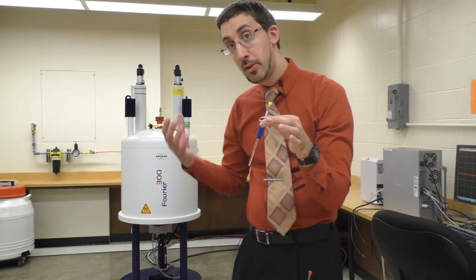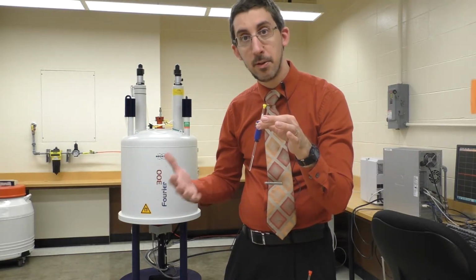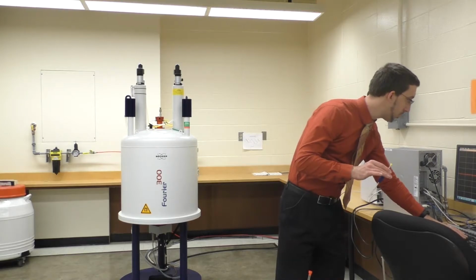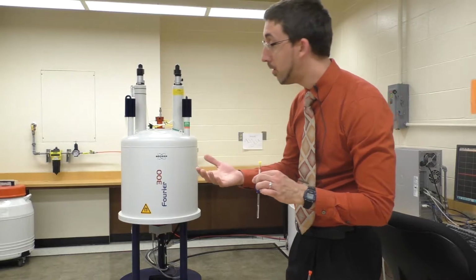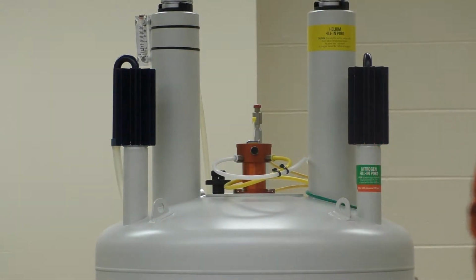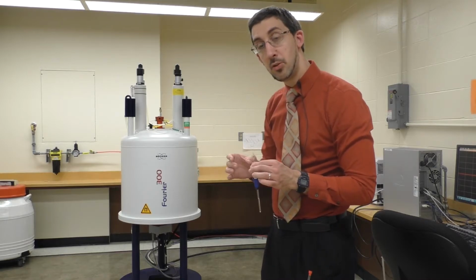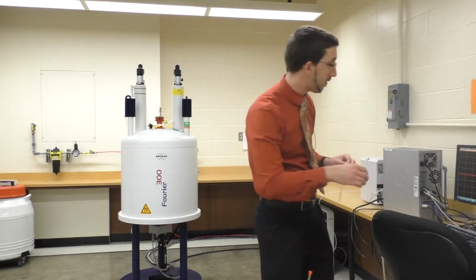Now, the NMR spectrometer, and most of them, will have a reference sample that sits in the magnet itself at all times. So we first have to eject that. So I'll come over to the computer, tell it to eject the reference sample. You'll see that pop up here. Pull this out. Place our sample on top of the blowing air, and it will sit there now until I tell the instrument to remove the ejector air so that it can sit back down into the instrument.